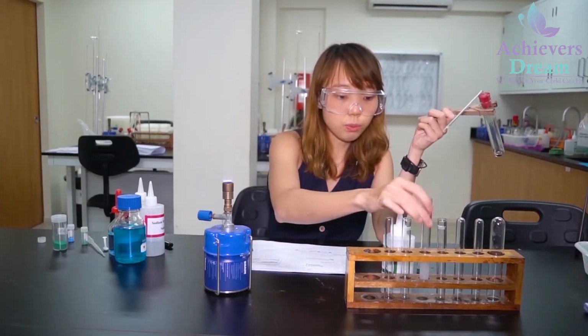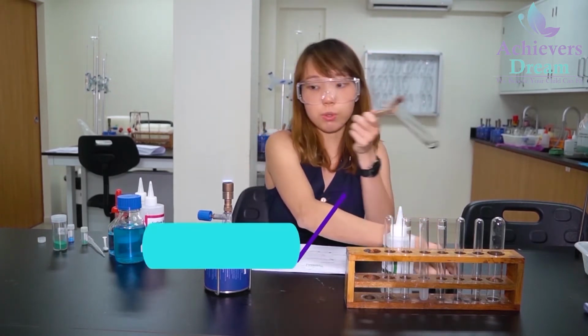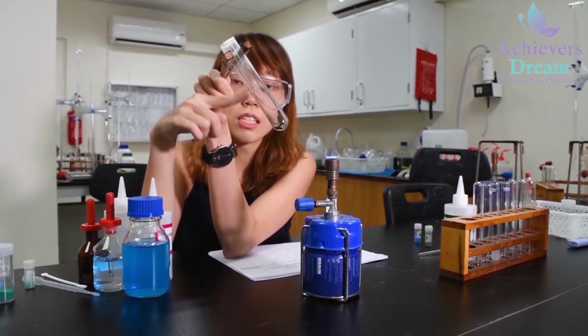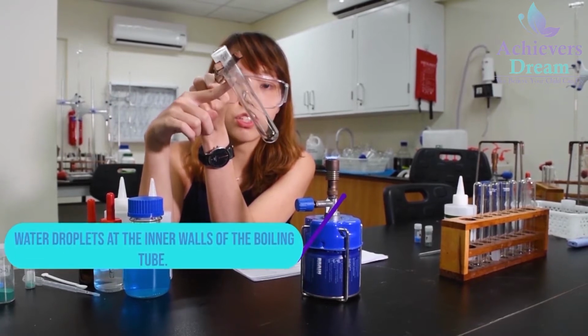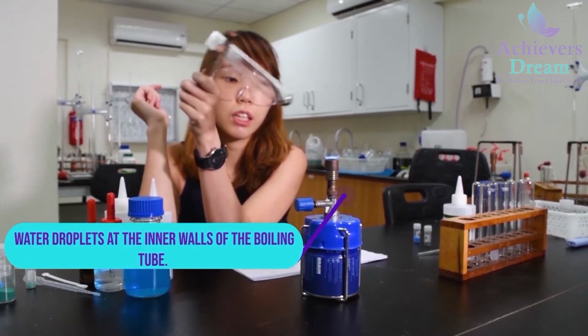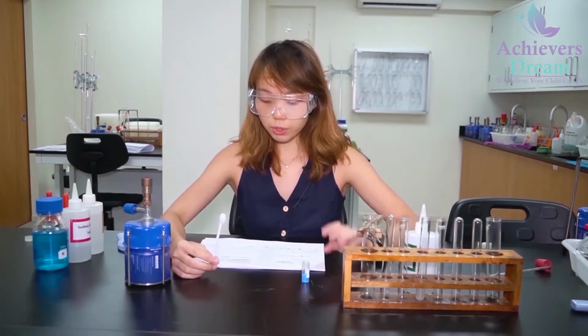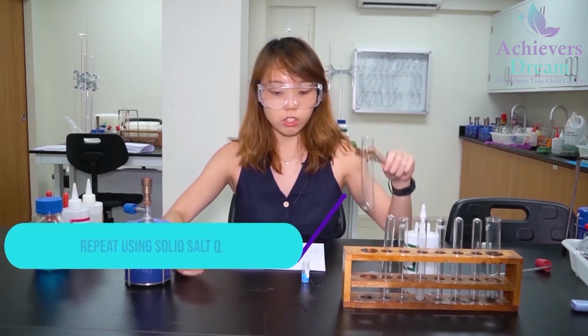Inside your boiling tube, your green powder has also turned into black solid. And if you notice at the sides of the test tube, along the inner walls, there is condensation, so there are water droplets present. So this is your observation for part A. Now for the next part, I'm going to repeat the whole process using solid salt Q.